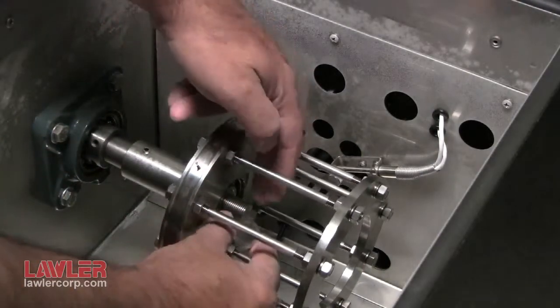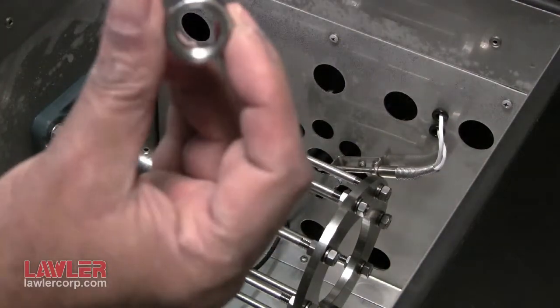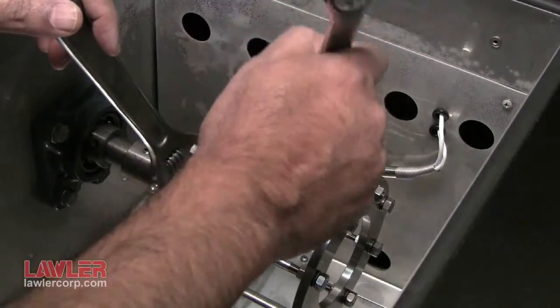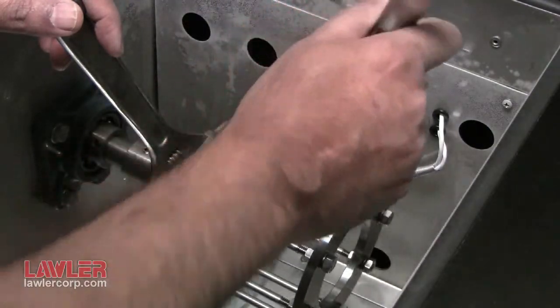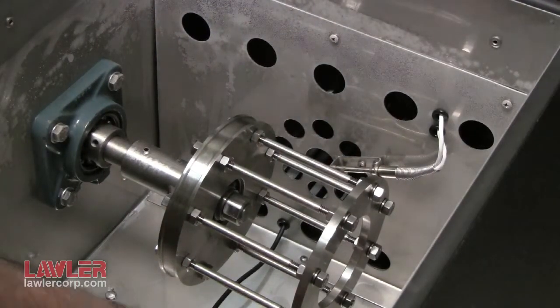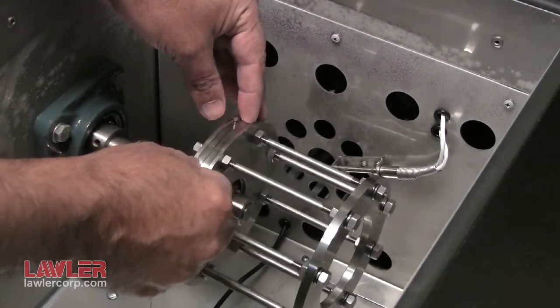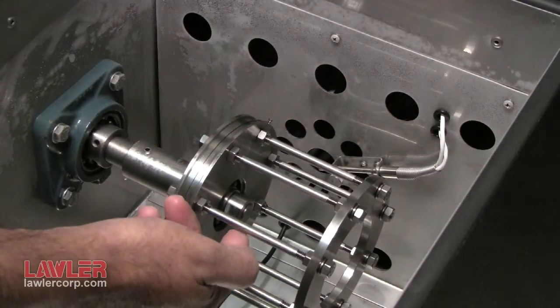The lock washer and lock nut — tighten using two wrenches. Take care not to over tighten. The last step is to take the fishing line with the loop and place it over the pin. That completes the setup for D1478.